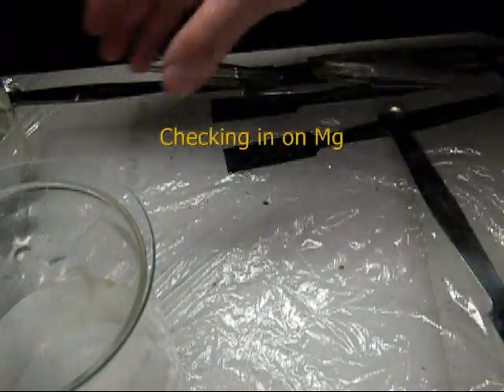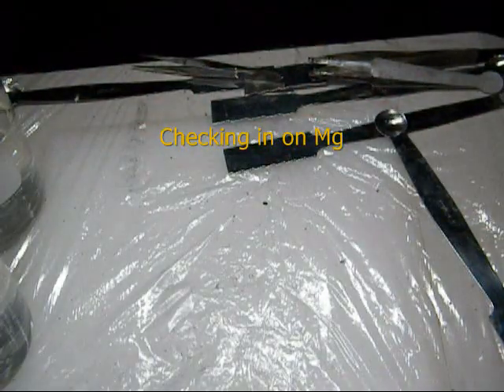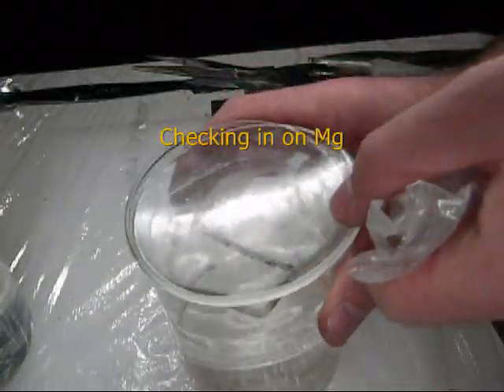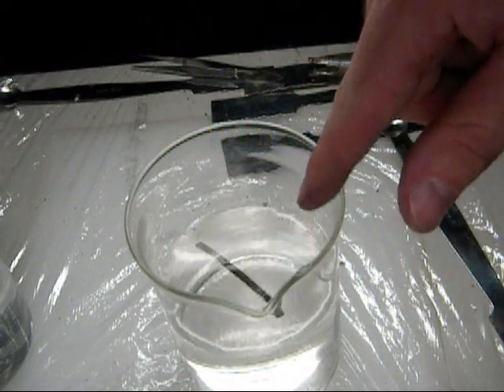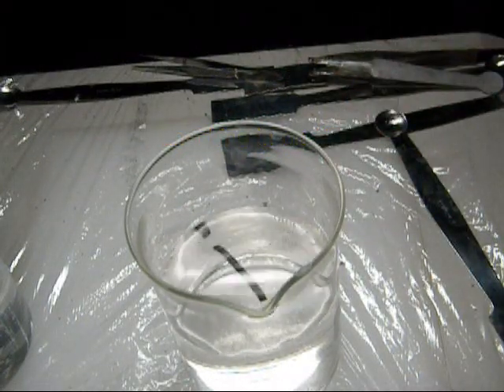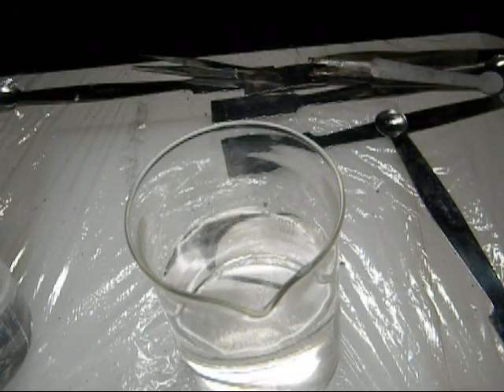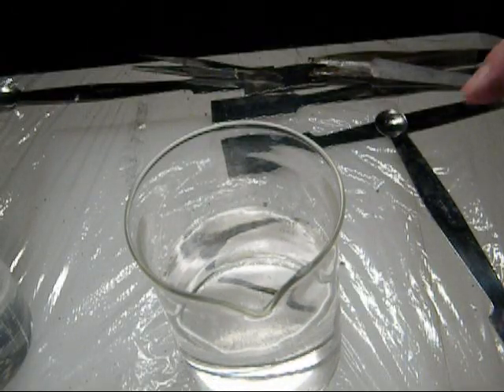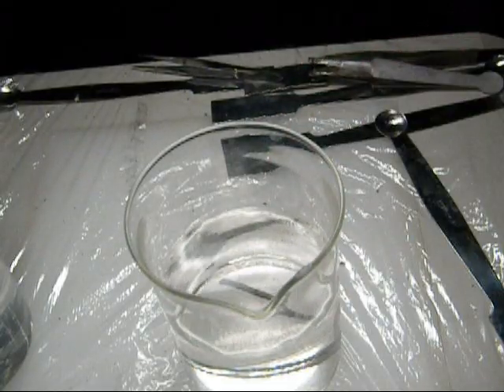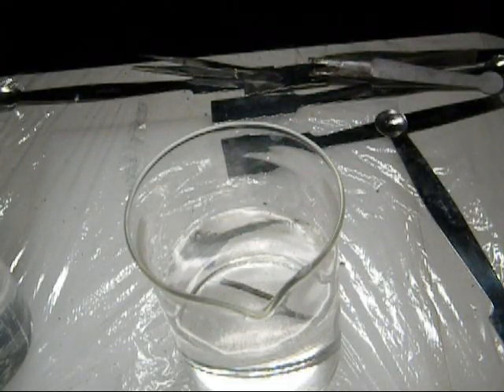Here as a demonstration. Real quick, one last time, we'll check in on our magnesium. Remember our magnesium we did way at the beginning? If you look really closely on the magnesium, you'll notice it's floating now. And, because it's floating now, that means that it's somehow become less dense than water. And the fact is, there's some bubbles on here. They're very tiny bubbles. And there I shook most of them. So, it reacts just very slowly.